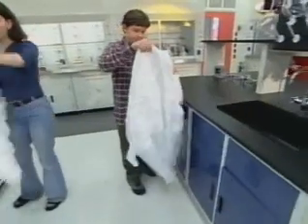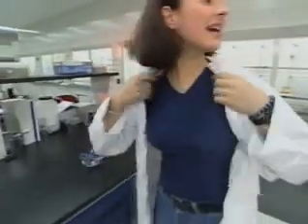So all of these kids are competing as a team. That's right. Lab safety is a team concept. One letdown by any individual and the whole team can get hurt. Speaking of the judging, each element is scored by the five judges on a scale from 1 to 10, and the average score is awarded to the team.